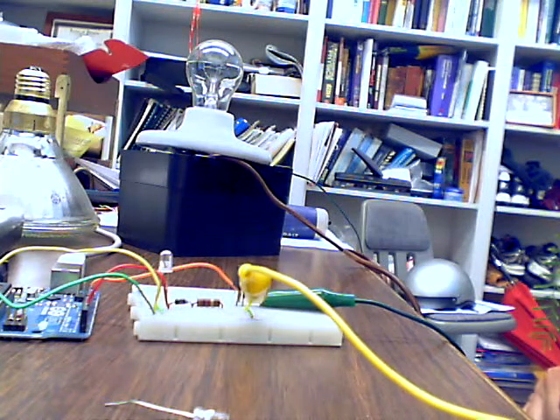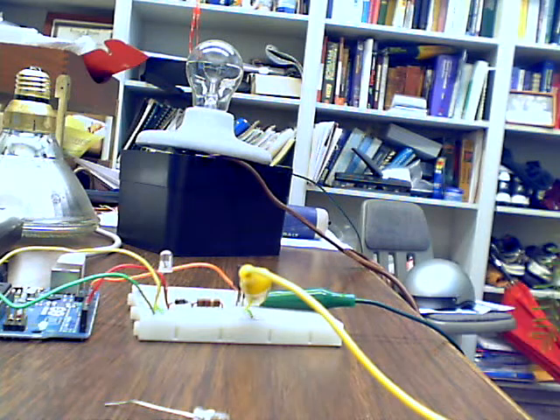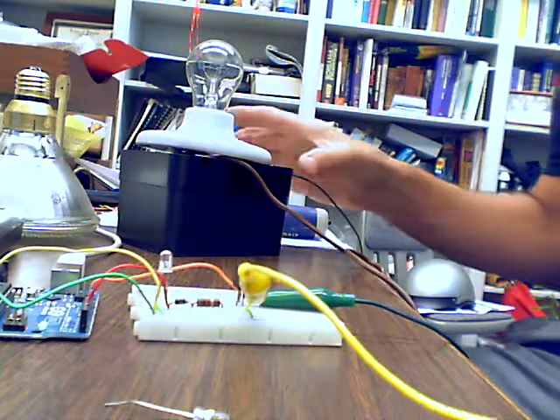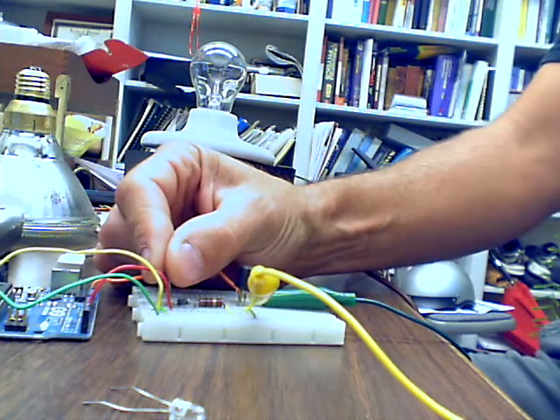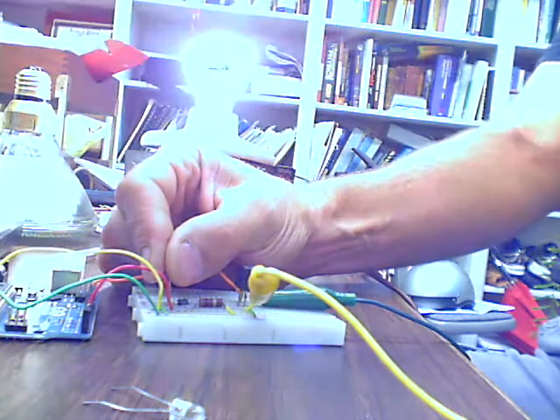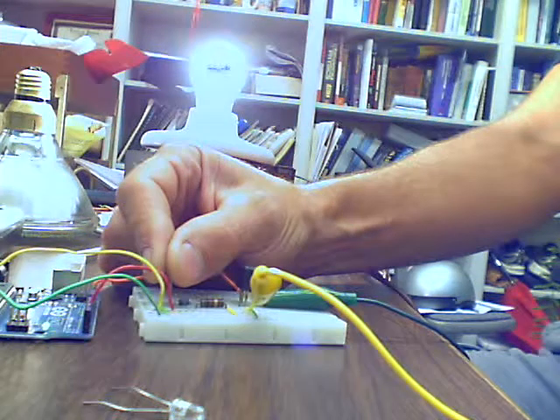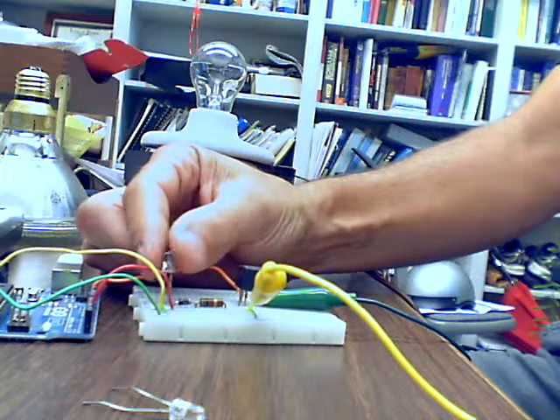Okay. So everything is connected now. I can plug into the wall, which I'm going to do. And then I can go into my serial monitor, and everything is running. I'm going to cover the photo sensor here, type Y, the light turns on, and when I expose the photo sensor, the light turns off, and I get the time it took for that to happen.